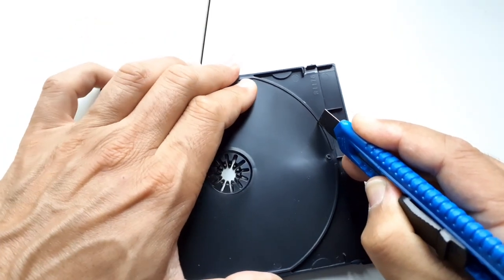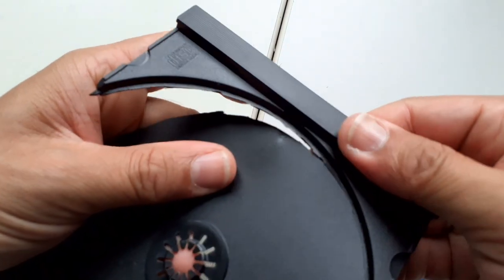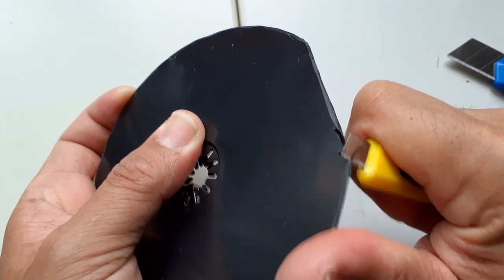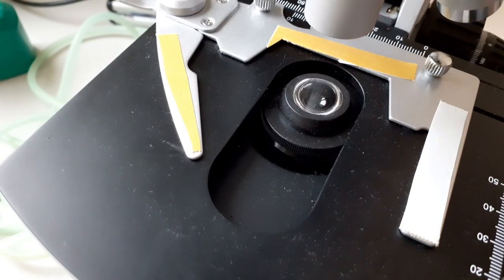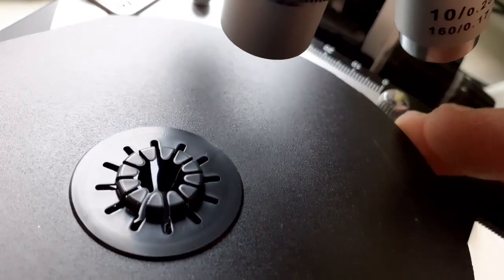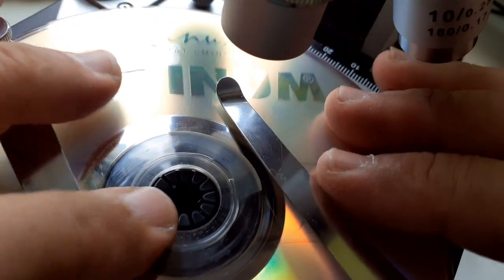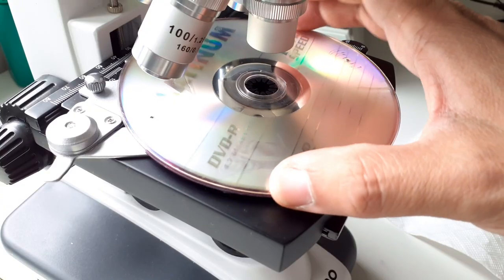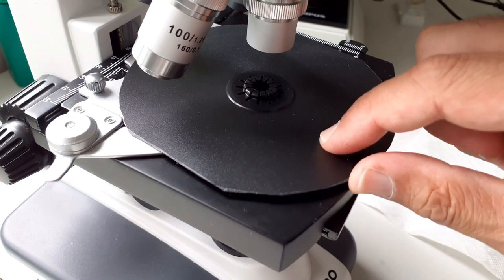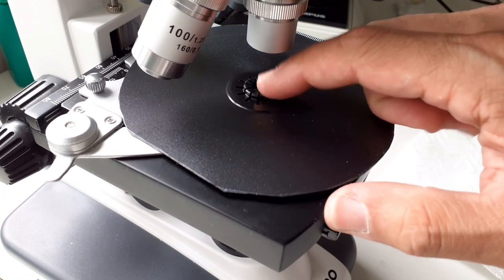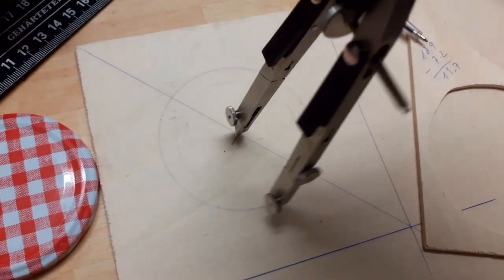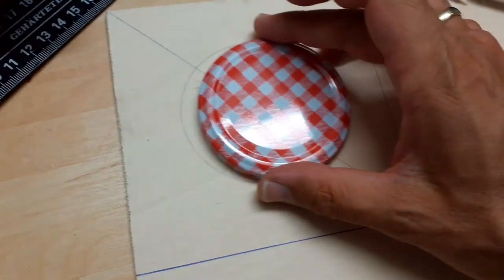The first trial that I made did not work out quite well. I used a CD-ROM. I'm going to show you that first. Then I think the second system worked a little bit better. The first try was to use a CD-ROM. I prepared a CD-ROM cover which should serve as a base for the rotating table. I used double-sided tape to connect the CD-ROM cover. Then there are two CDs that I taped together as well. But the whole system was a little bit too wobbly.